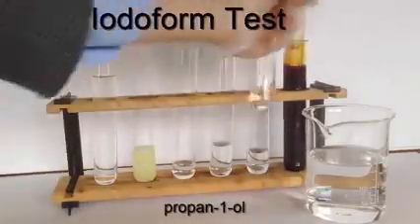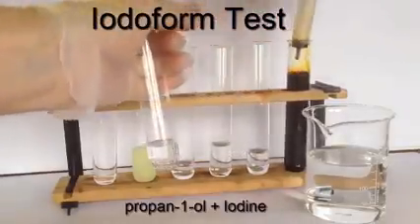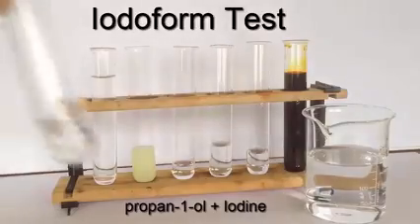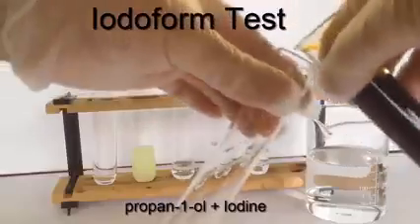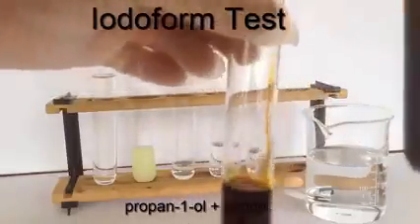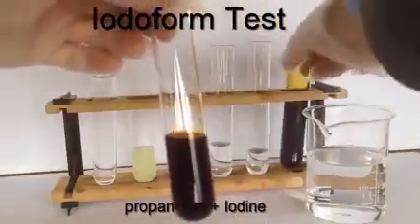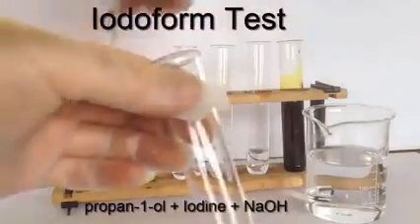I'm going to add about 1.5 times as much of 10% iodine solution, dissolved in potassium iodide. Note that iodine doesn't actually dissolve in water, but it dissolves in a dilute aqueous solution of potassium iodide. It actually goes into solution as the I3 minus ion, from which I2 can be liberated very quickly.